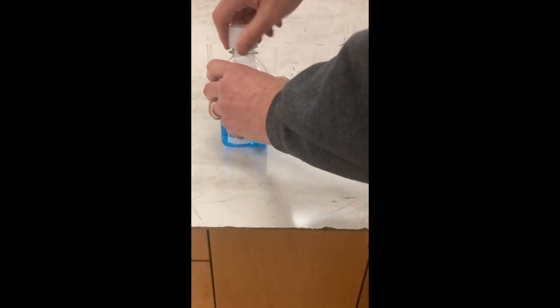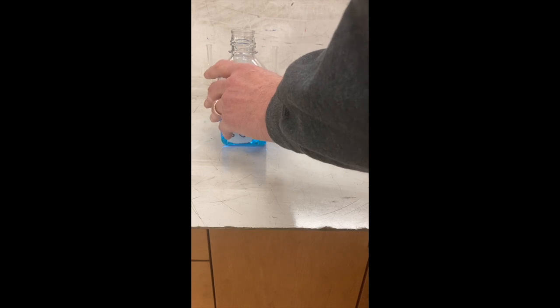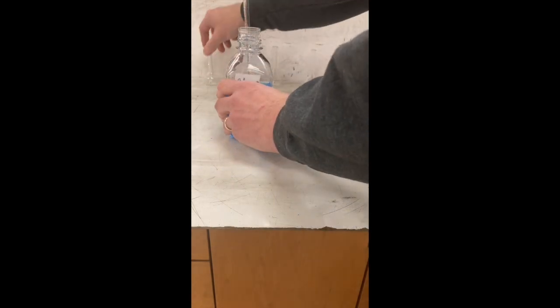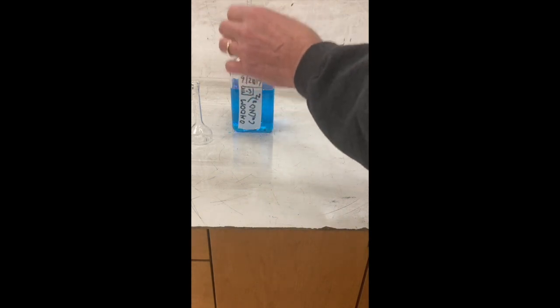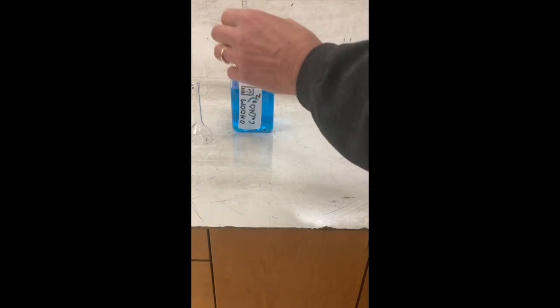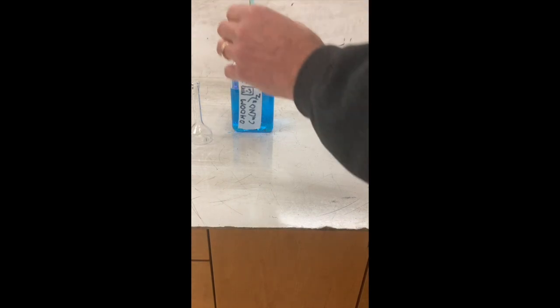So we're going to use copper nitrate as a calibrator, a way to get our Beer's law curve. So this is 0.4 molar copper nitrate, and we're going to produce 4 different solutions by diluting this solution in 25 milliliter volumetric flasks. So I'm going to use a volumetric pipette, a precise tool for delivering a set amount of any solution. It's kind of like a fancy calibrated eyedropper.